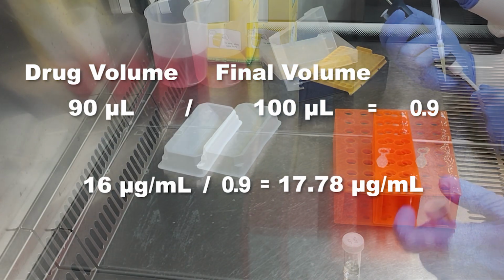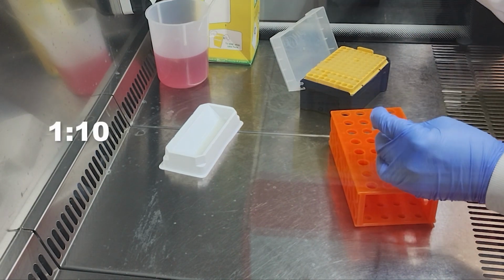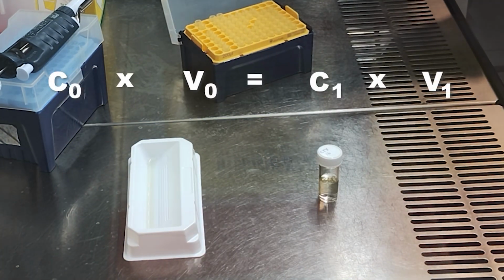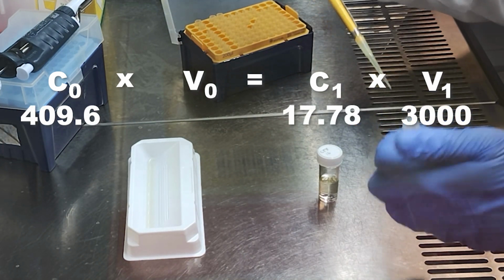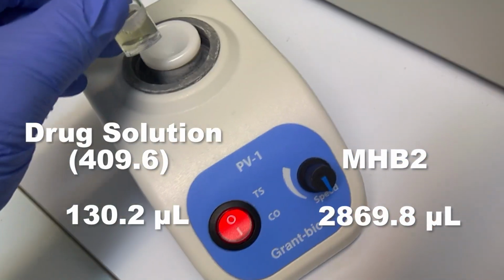To get from 4096 to 17.78, we will do 2 dilutions. First, we will do a 1 in 10 to take us to 409.6. Mix well, and then dilute again to make 17.78. Let's make a large enough volume to easily cover our needs. We'll make 3 ml today. For that, we need to add 130.2 microlitres to 2869.8 microlitres of growth media.